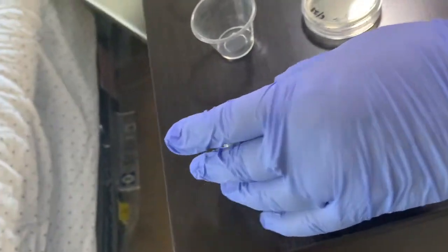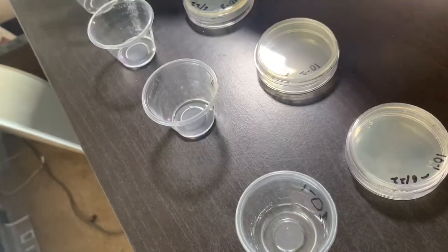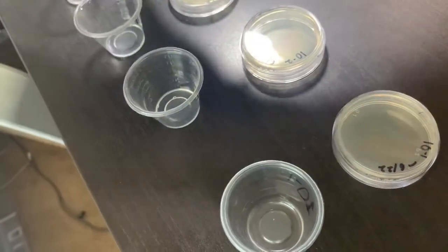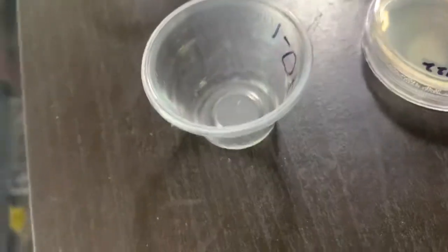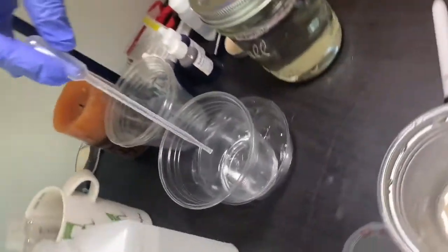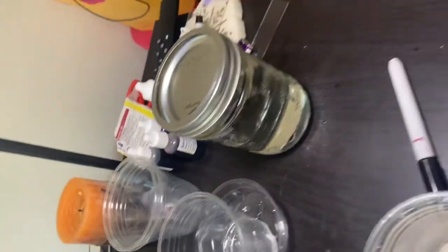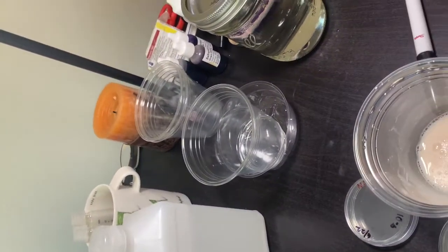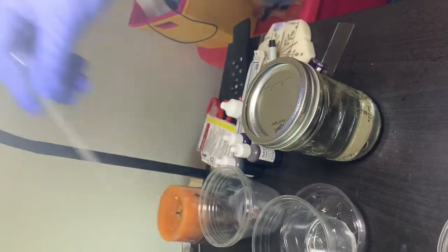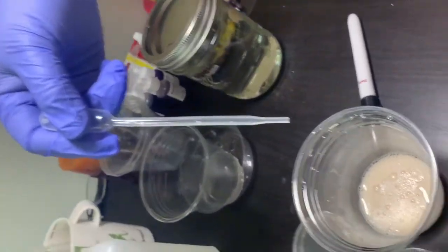So first things first, in all the cups I have to put 2.25 ml of distilled water. All the cups are filled with 2.25 ml of distilled water, but I left one cup so that I can show you. I already put my marked pipette in alcohol to rinse it carefully, so I'm getting rid of the excess alcohol and making sure there is no alcohol in it. And then I will draw 2.25 ml of distilled water.